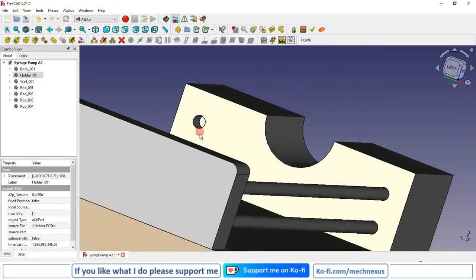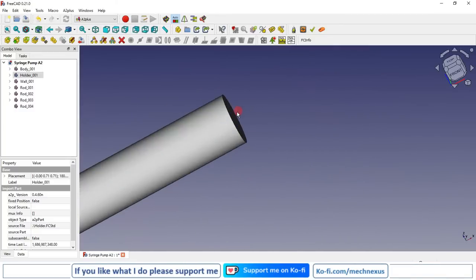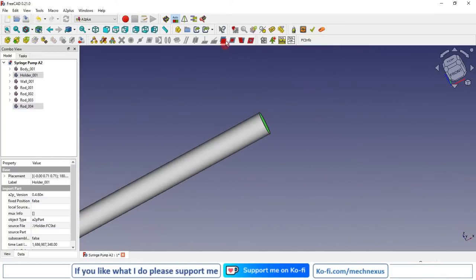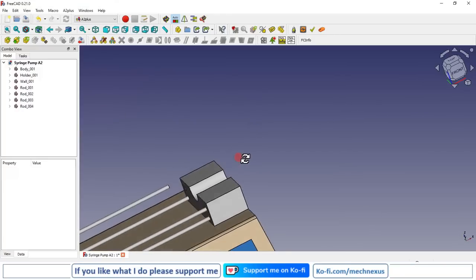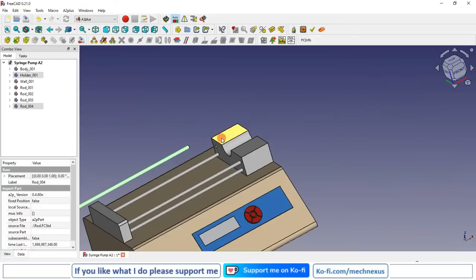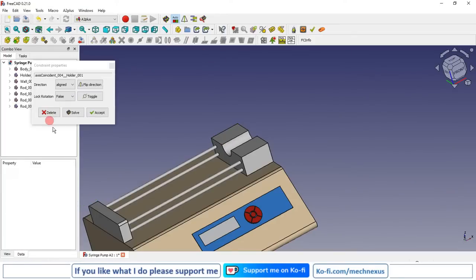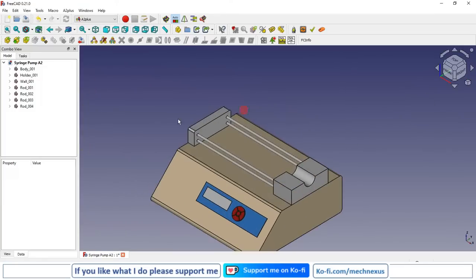I will select this face and this face, give coincidence, accept, select surface and select this surface and give axial constraint. So we have assembled all 4 rods.